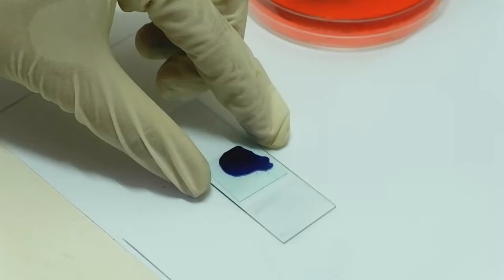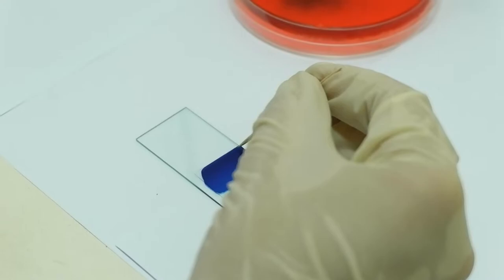Now put on a clean cover slip and press down hard to spread out the fungus.